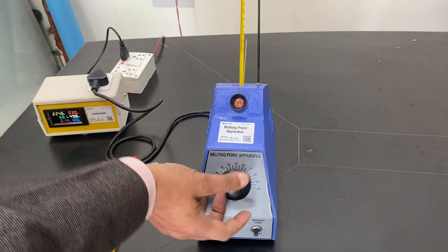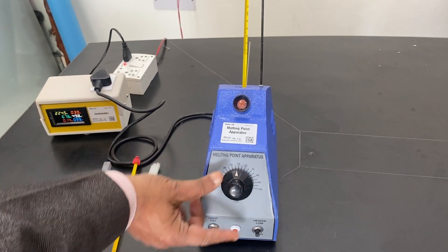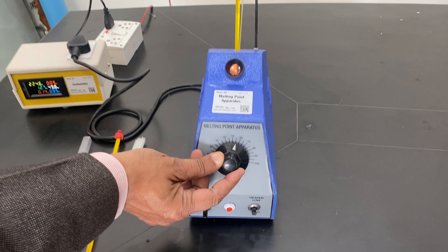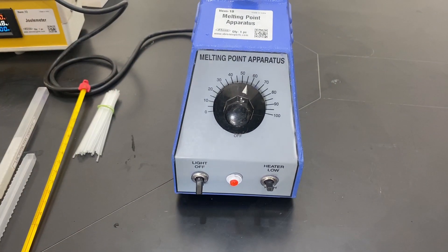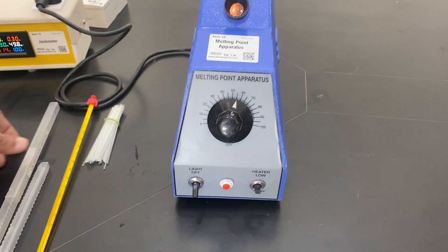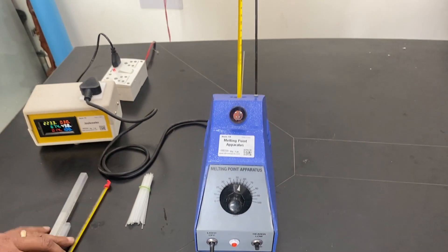And 70 has been reached, then you can reduce it and make it off. Then slowly increase. Now it is slow, very slow increase in the heating. You can see the manual - a detailed manual is there.